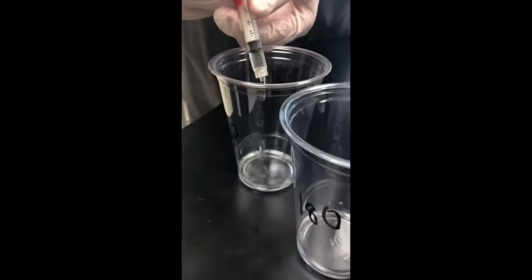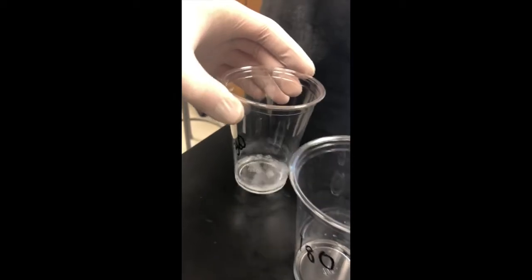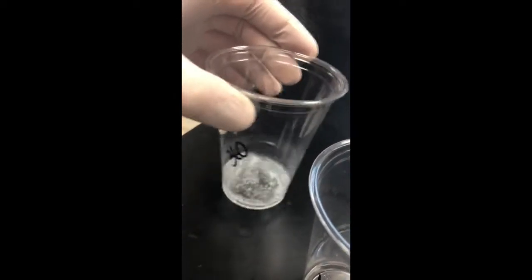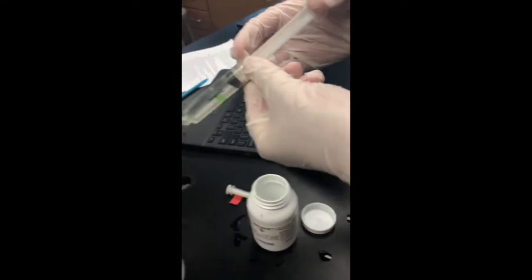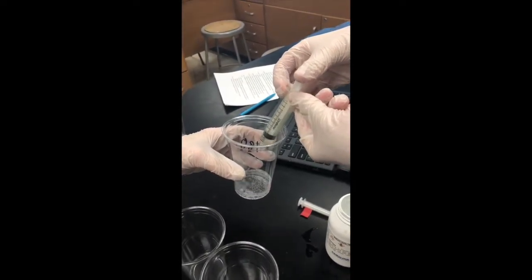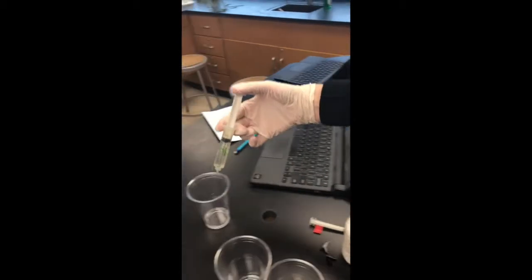1 milliliter of catalase extract was then added to each of the 7 cups and was allowed to react with the H2O2 for the amount of time that was written on the outside of each cup. A lab member was always ready to begin a timer as soon as the catalyst was added. Another lab member would then swirl the cup gently until the time had elapsed, and a pre-measured 10 milliliters of H2SO4 would be added, denaturing the enzyme and thus stopping the reaction. We repeated these steps 7 times, allowing the reactions to proceed for the 7 time intervals we were observing.